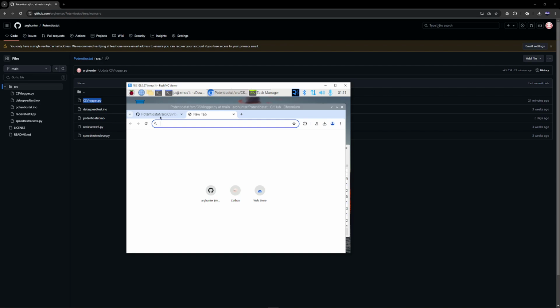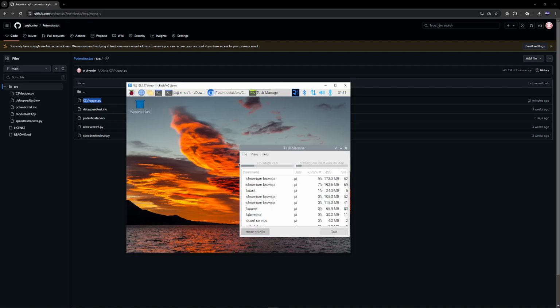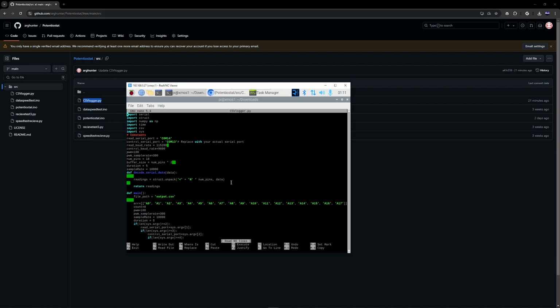So what I've done here is, okay, it's lagging a bit. Okay, anyway, I've downloaded the CSV logger file here. And, okay, it's in my downloads. You can see it over there. And you can see it over here.